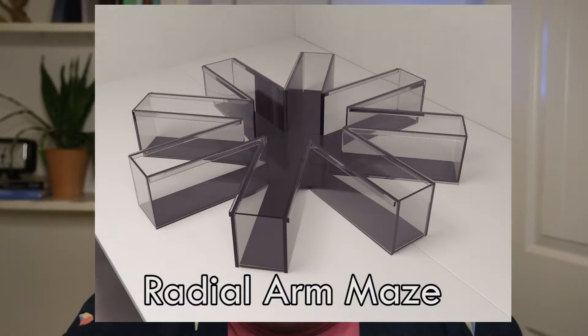Next, let's talk about a really fun one: the radial arm maze. It's got a bunch of arms radiating out from a central hub — typically at least eight arms, which can be closed off or removed as needed. Usually this maze is used for studies of short and long-term memory. Say you have eight arms and bait four of them with food, leaving the others empty. A rat is put in the maze and has to find all the food. Every day the same four arms are baited. Knowing which arms are baited requires retaining a memory over at least 24 hours, so if the rat enters an arm that was never baited, it's counted as a long-term memory error. As the rat goes around and eats the food in an arm, the food is gone, and it doesn't make sense to return to that arm. Revisiting a depleted arm is counted as a short-term memory error.